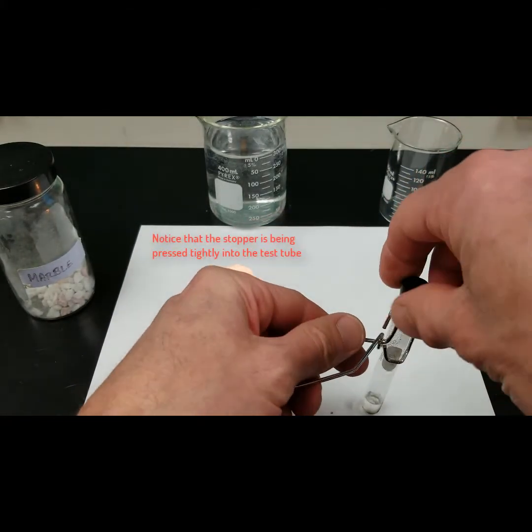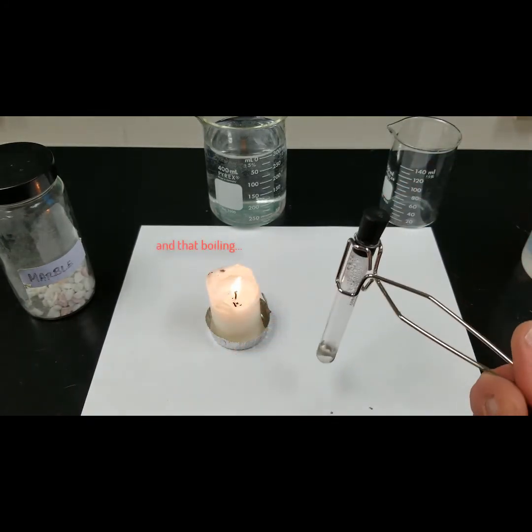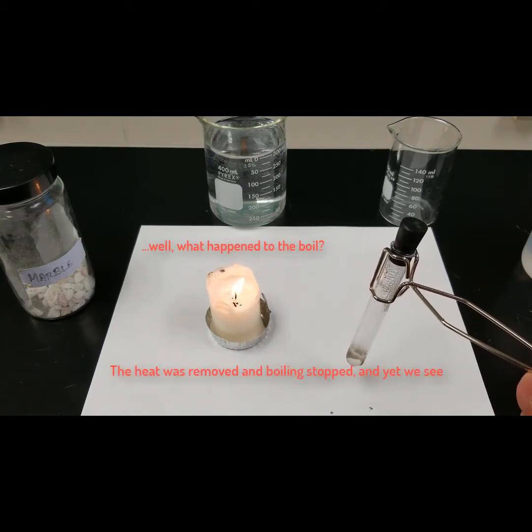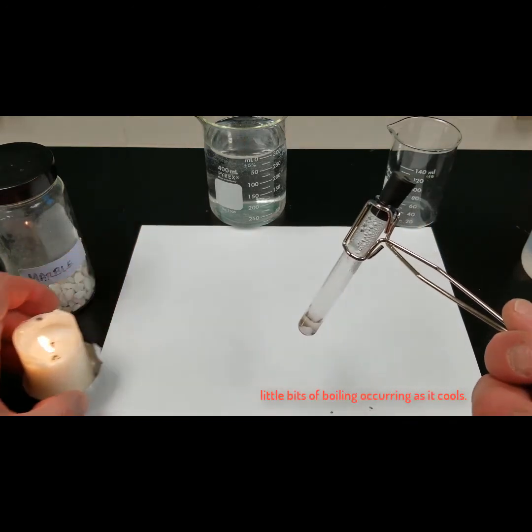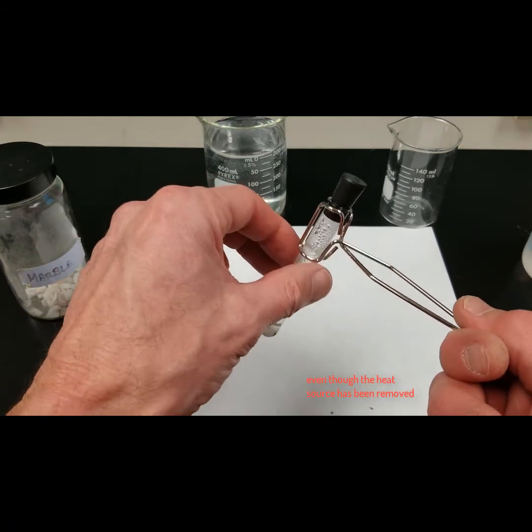Notice the stopper is being pressed tightly into the test tube, and that boiling, well, what happened to the boil? The heat was removed and boiling stopped, and yet we see little bits of boiling occurring as it cools, even though the heat source has been removed.